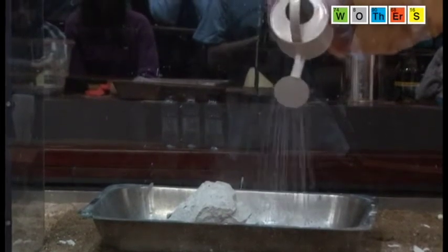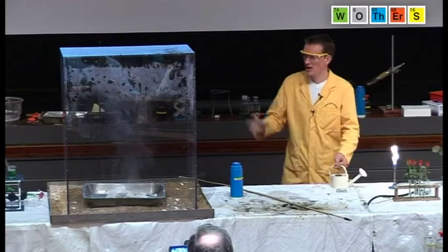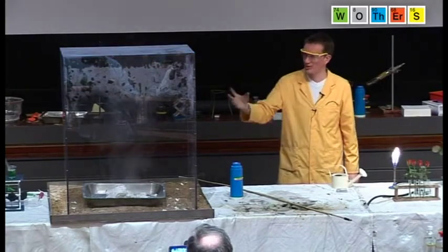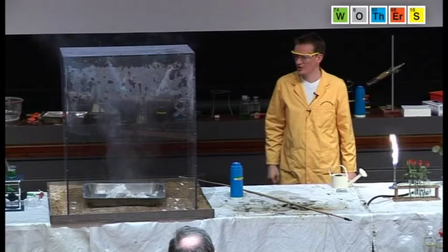This is so reactive, it's generating an awful lot of heat during this process, and that's causing the water to boil around here. We can see the steam that's coming out of this reaction.